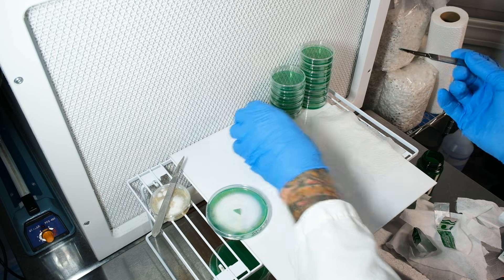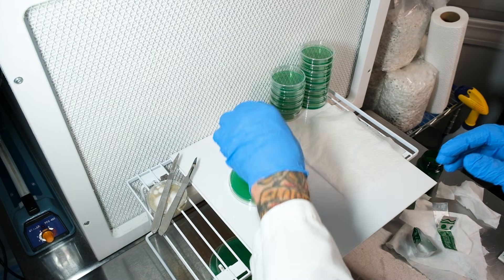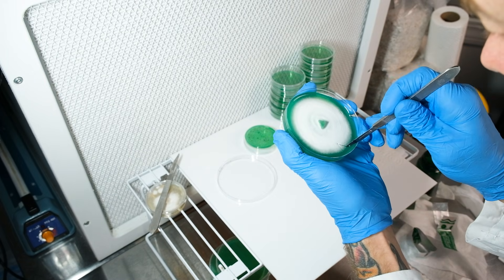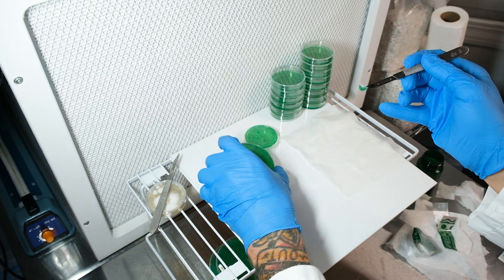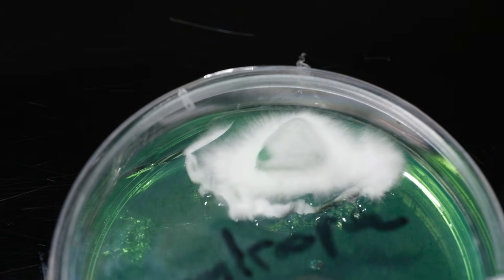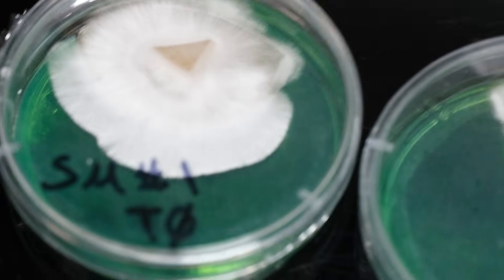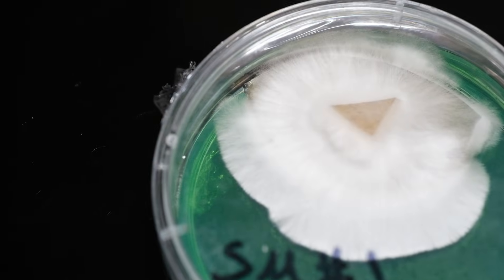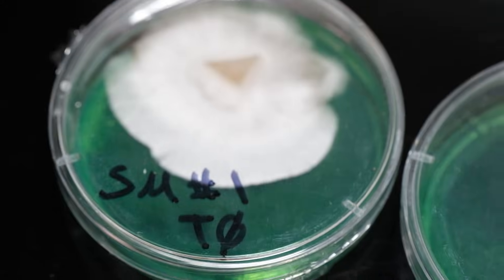Take your suspected contaminated plate and using a flame-sterilized scalpel take a sample from the leading edge, then quickly and smoothly place that sample on the island you created inside the trench. The mycelium will jump across that trench and you'll be able to grab a clean sample without the bacteria. Here are some plates I did three weeks ago — the mycelium had no issue crossing that barrier and the leading edge looks clean. I'll then transfer to a water agar plate first, then once that grows out grab a transfer back to a nutritious agar and continue using that culture.